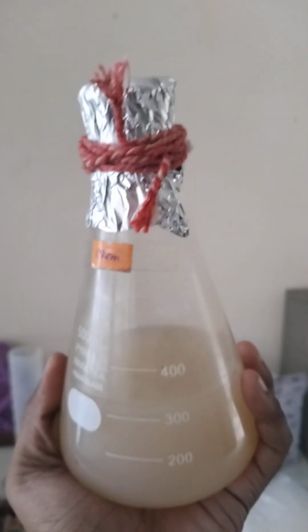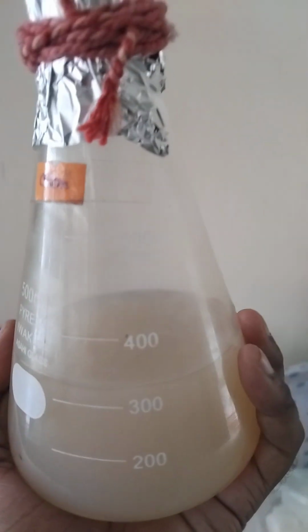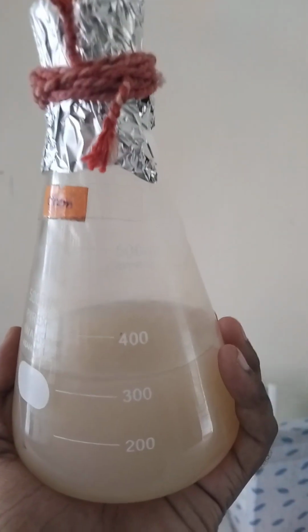So at first, this is the nutrient agar that I produced in the conical flask. If you'd like to create this kind of agar, at first you have to keep in mind that there is a specific measurement. By following it, you'll be able to create 250 ml of nutrient agar for growing your bacteria.